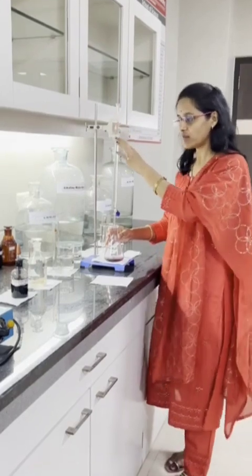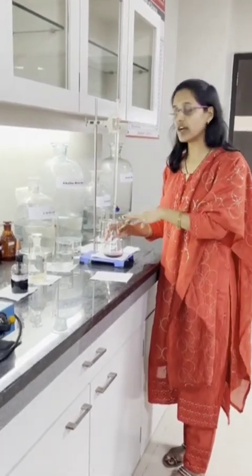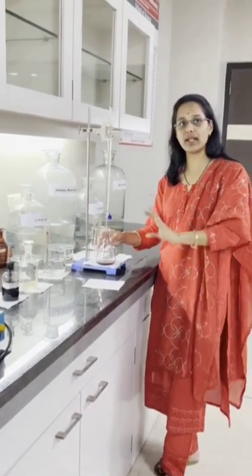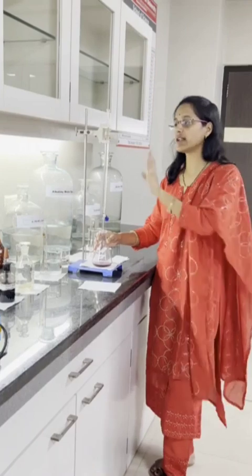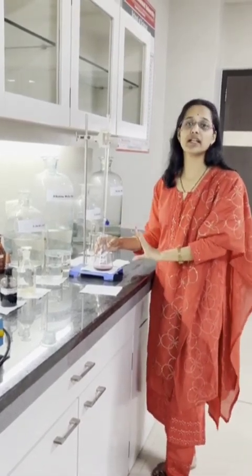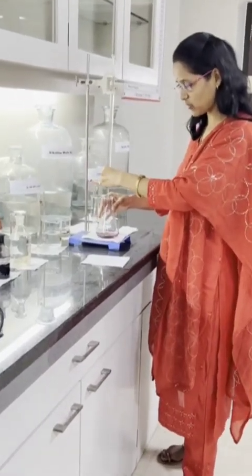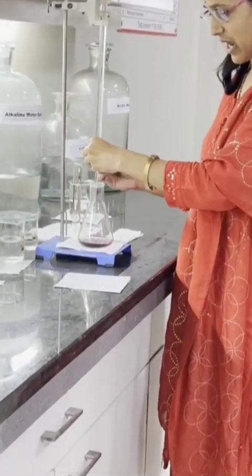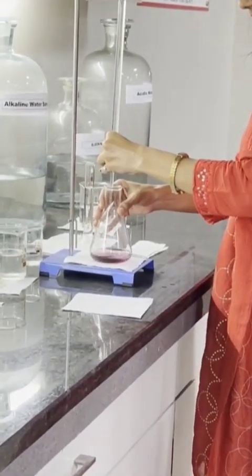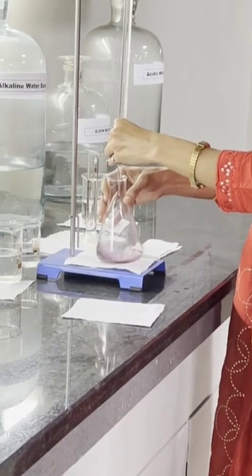When we are adding the EDTA solution from the burette, we are getting the sky blue color — the wine red color complex is getting removed. A more stable complex with EDTA will form with the metal ions, meaning Ca²⁺ and Mg²⁺. The Ca²⁺ and Mg²⁺ which are present in the water are nothing but the hardness-causing ions. Whatever Ca and Mg present in the water — they are nothing but the hardness of water.